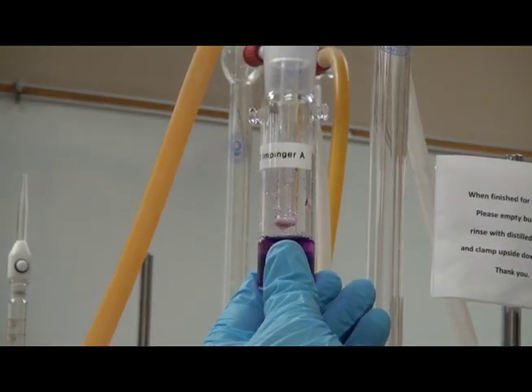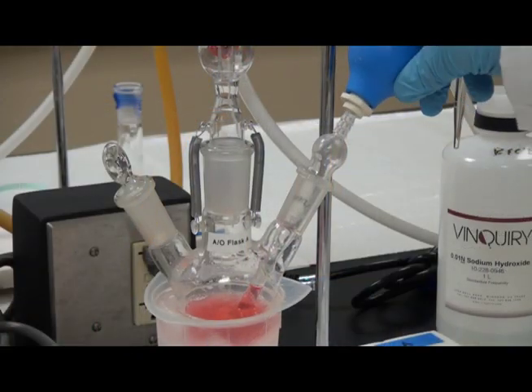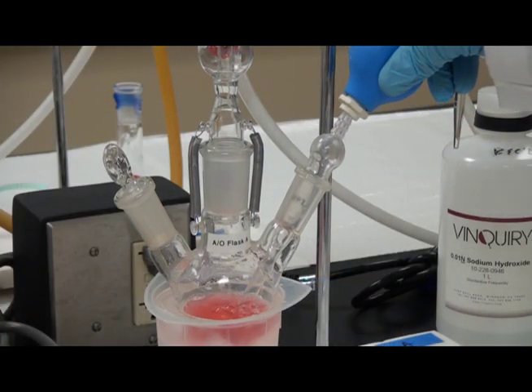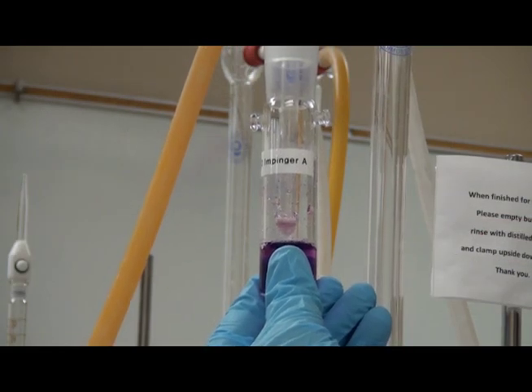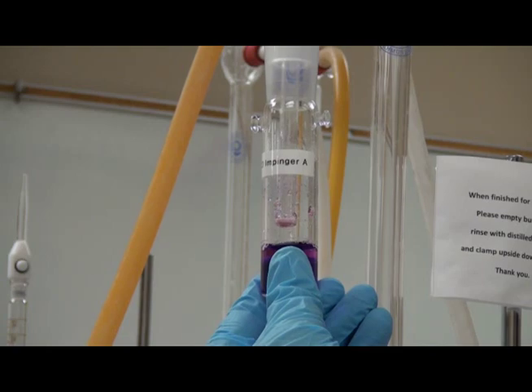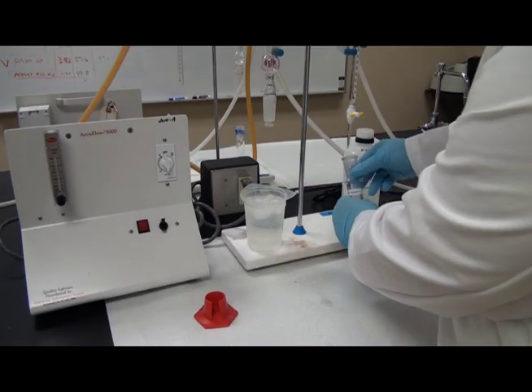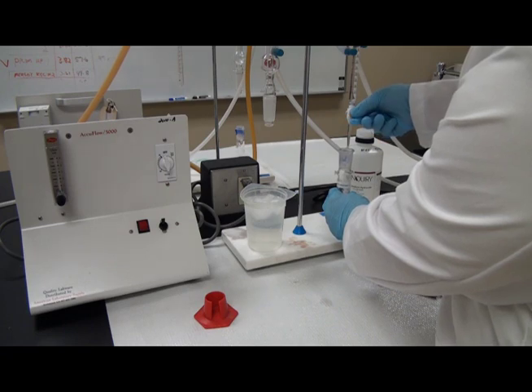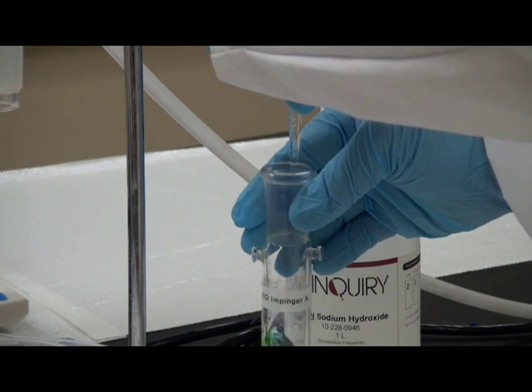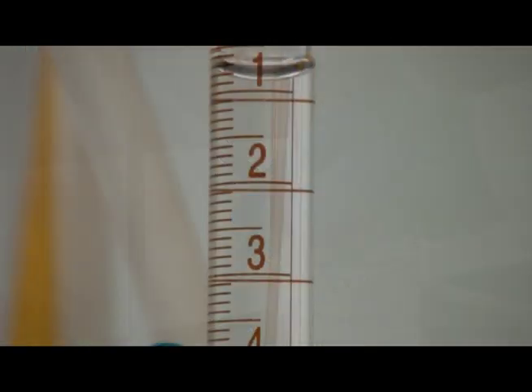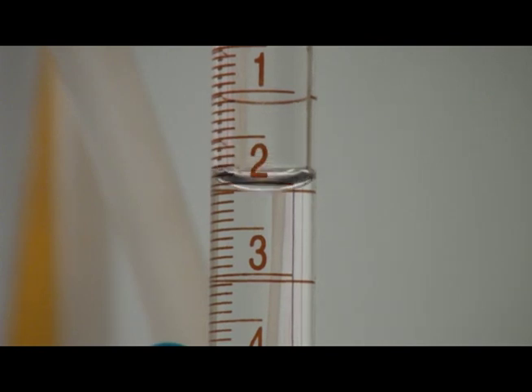Release the vacuum by loosening the impinger tube. Blow out any drops left in the impinger by using the safety bulb on the flask bubbler tube to clear the impinger tip into the impinger tube. Titrate the hydrogen peroxide solution with 0.01 normalized sodium hydroxide back to the start point gray-green color. Be sure to make note of the start and end points in milliliters on the titration burette. Record the value.